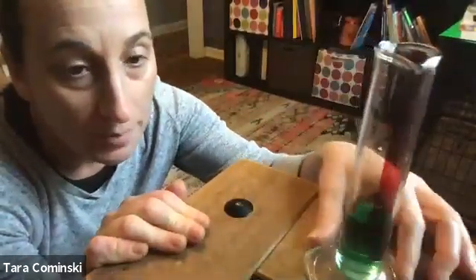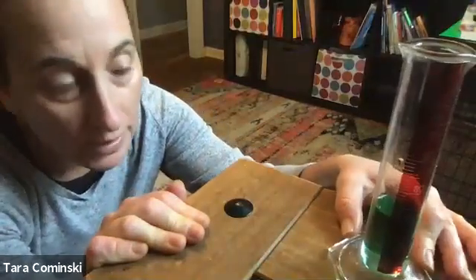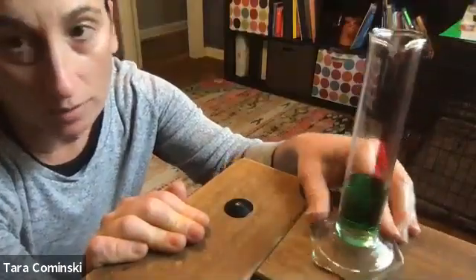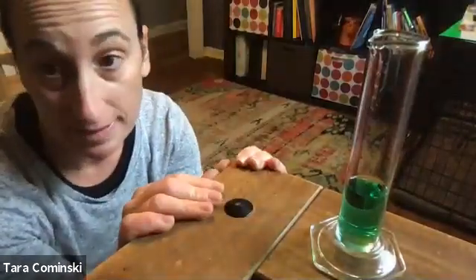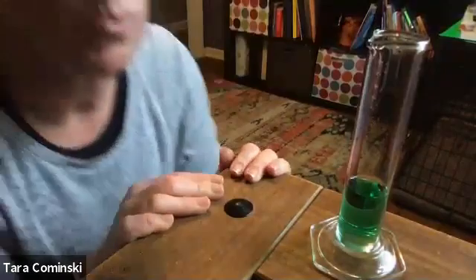Anyway, you can see that I basically poured water in here, green water, and I poured it up to that 20 milliliter mark, okay? So if we're measuring 20 milliliters, what you wanna do is you wanna get eye level, and you're gonna see the water has this sort of dip in it, and you measure at the bottom of that, and that's called the meniscus, okay? So that's the proper way of measuring volume in the lab.